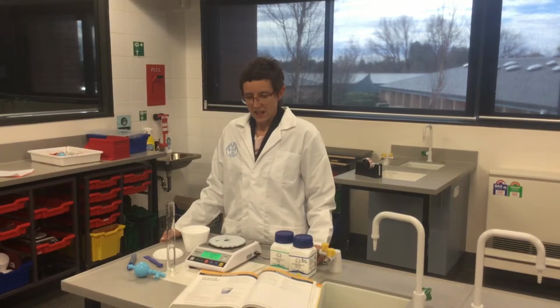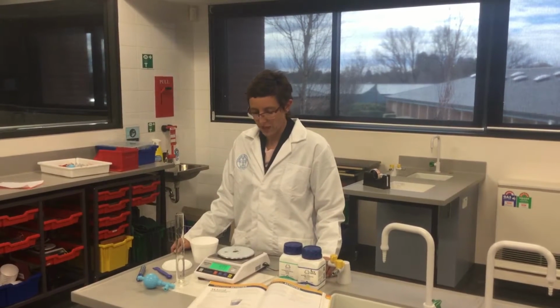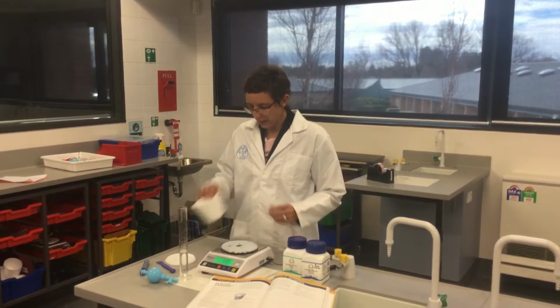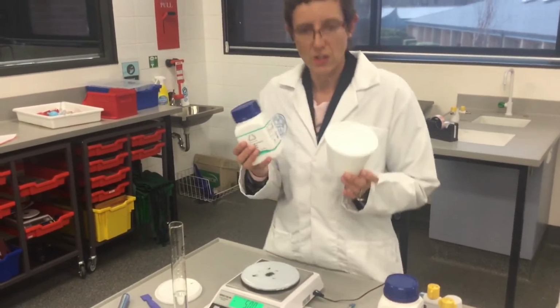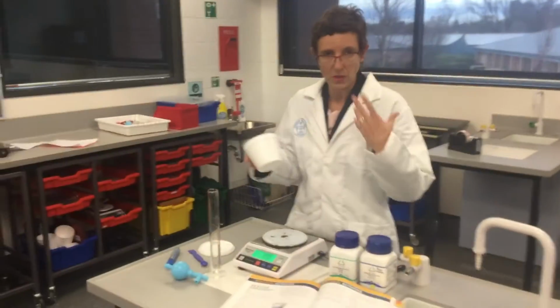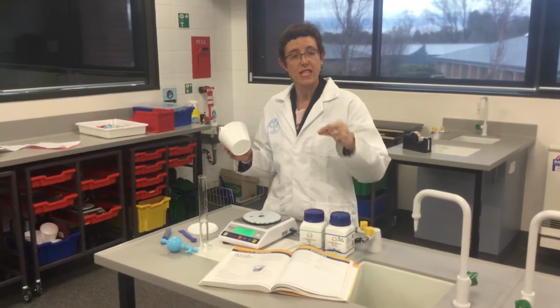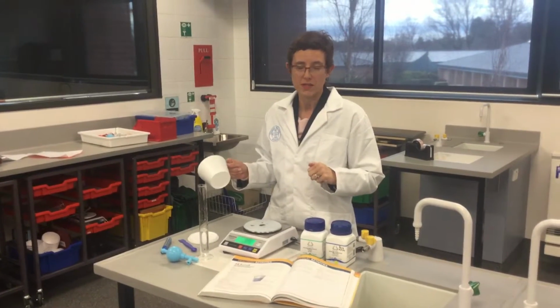We're going to measure the heat of solution today using calorimetry, using the H equals mcΔT, so the MCAT equation. What we're going to do is see how much energy is used to dissolve that, or energy is produced. You're going to get either an increase or a decrease in temperature, depending on whether it is an exothermic or an endothermic process.